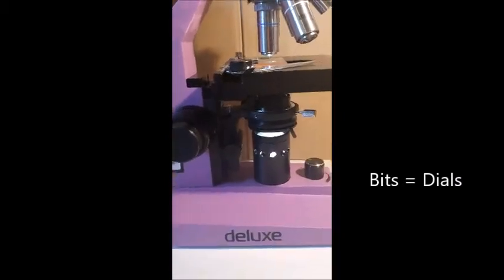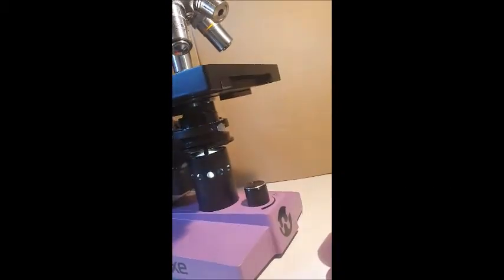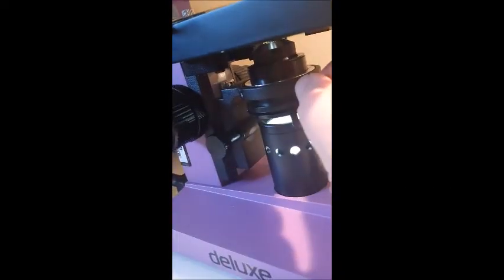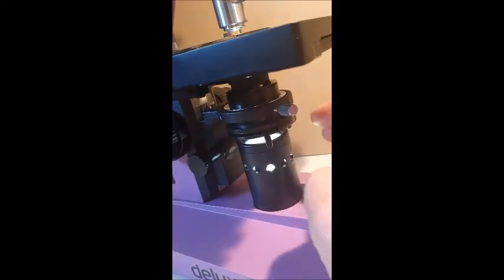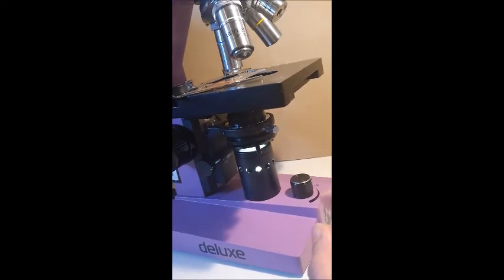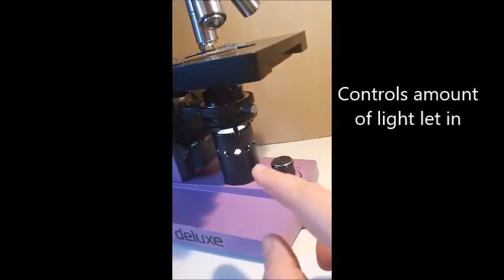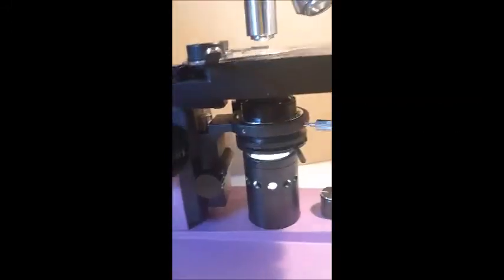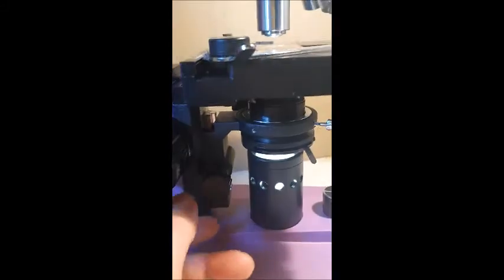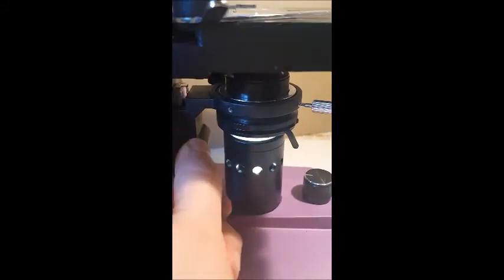Okay. Now, what do we have underneath the stage? We have this, which is called a condenser, which is basically like your iris in your eye. It goes smaller and bigger to let in more or less light. So the condenser, you can adjust with this little knob, which makes that bit go up and down.